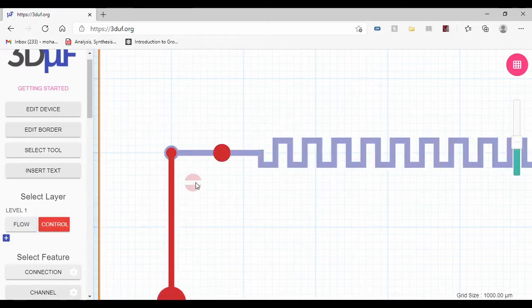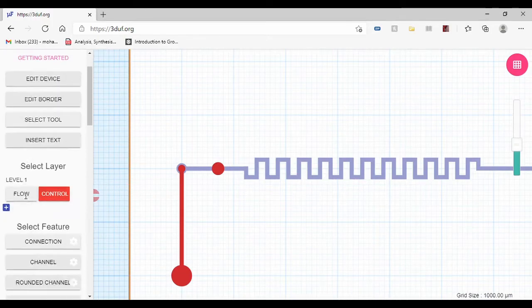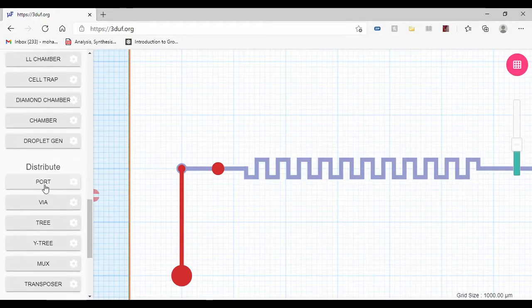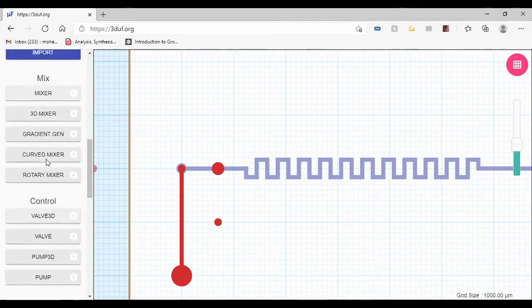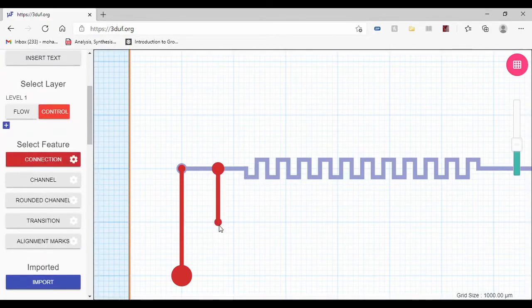So this 3D valve works by having another fluid connected to the 3D channel. So what I will need to do, I need another port that I will connect the valve into. So I'm going to add another connection. All right.